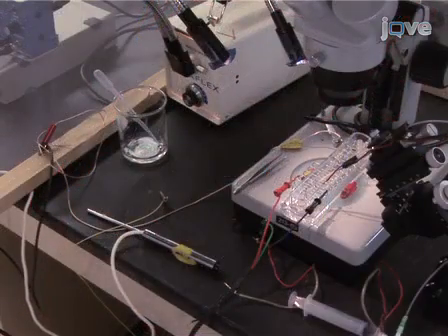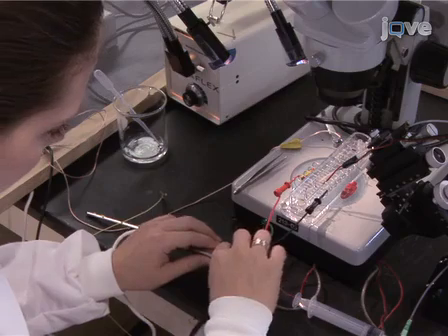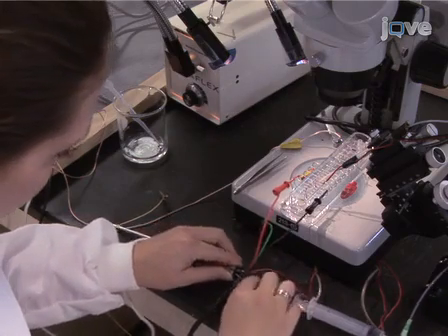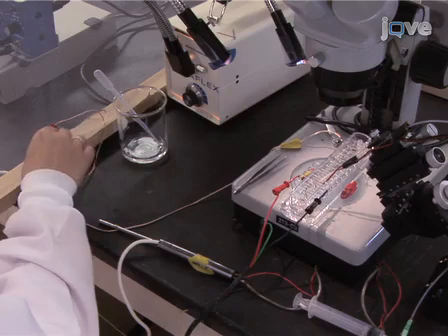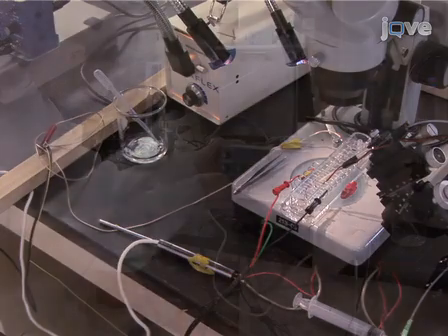Attach the electrode to the head stage probe by attaching one wire from the suction electrode to the positive input of the probe and the other wire to the negative input. It does not matter which wire goes to which input. The probe can be grounded to the Faraday cage or the saline bath with use of a silver chloride wire, or connected to the ground input on the differential amplifier to decrease potential 60 Hz noise.